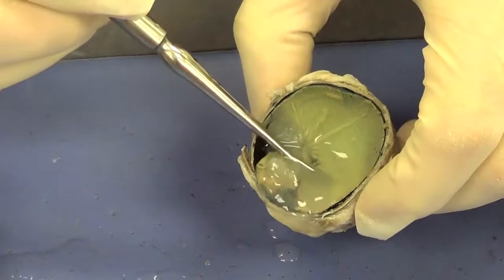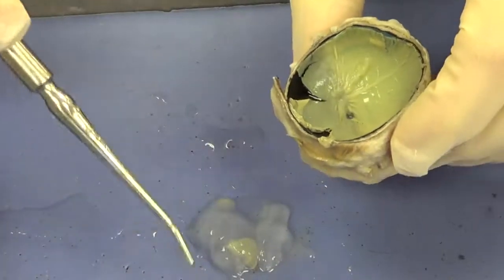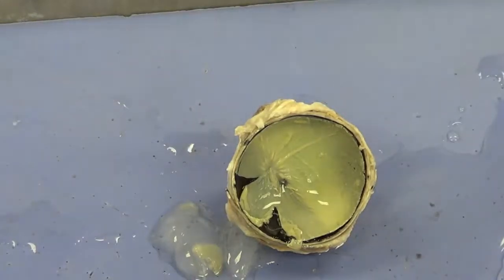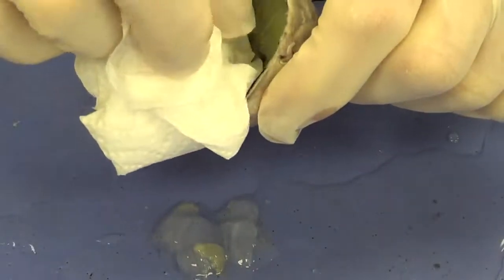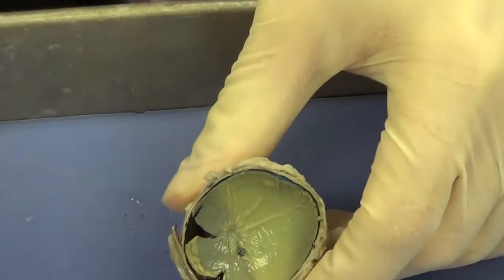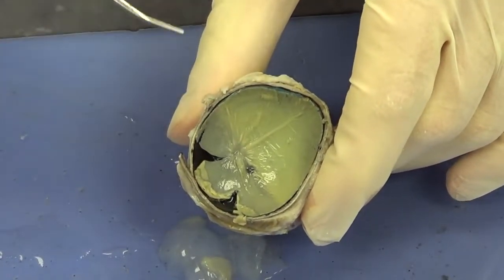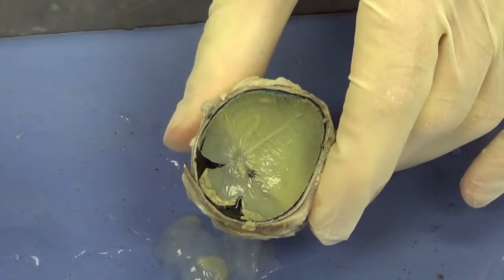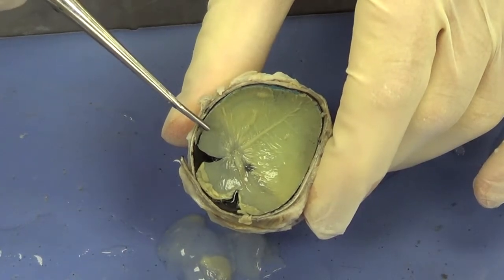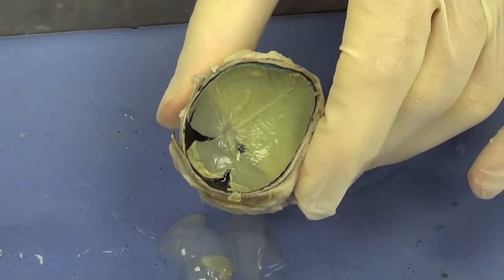What I'm going to do is gently try to get rid of some of this vitreous humor, just kind of pour it out, nudge it out the side of the eye. And then I'm going to take a paper towel and dry this up just a little bit so that we can see clearly in here. And we can see this cream-colored material that coats the inside of the eye. This cream-colored material is the retina. This material is probably the most important part of the eye as it contains all the photoreceptors, the light detectors that actually detect the incoming light.